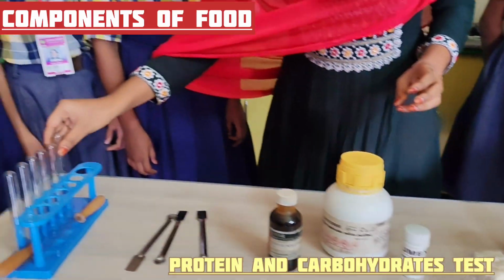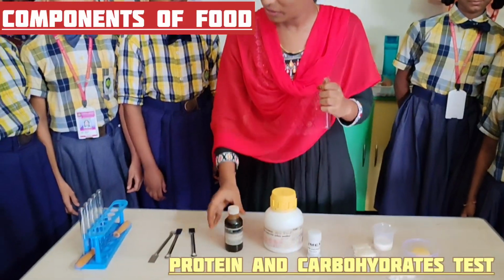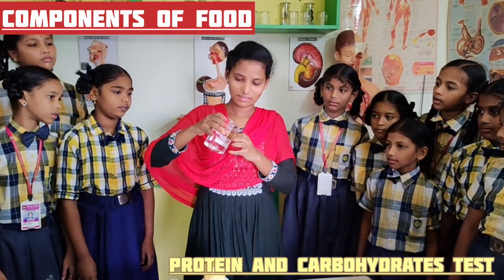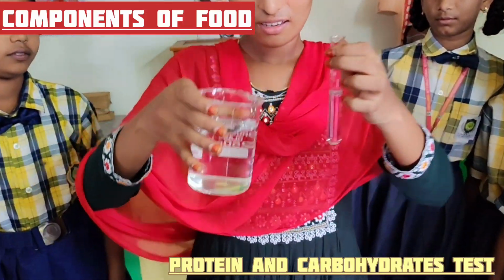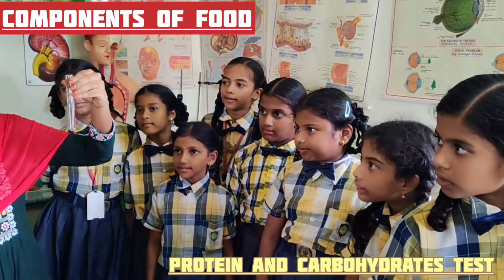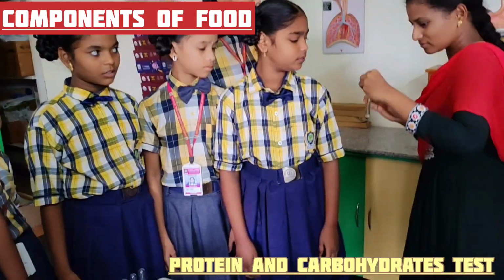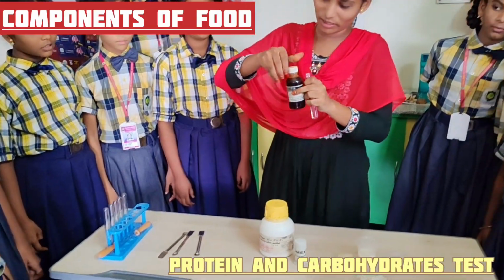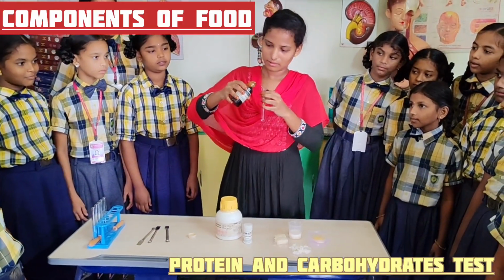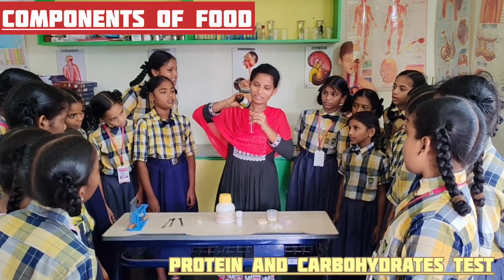First, we have to prepare iodine solution. How to prepare iodine solution? We have to take a test tube half filled with water. Once observe, I filled water up to half. Half of the water I took in the test tube. Now, I'll add iodine solution to it. A few drops of iodine are needed.